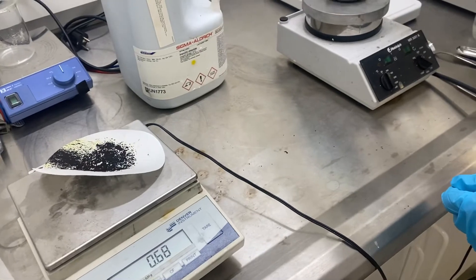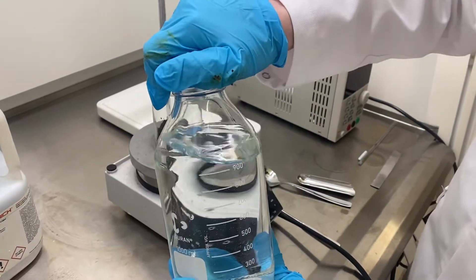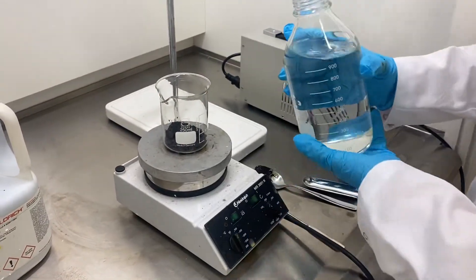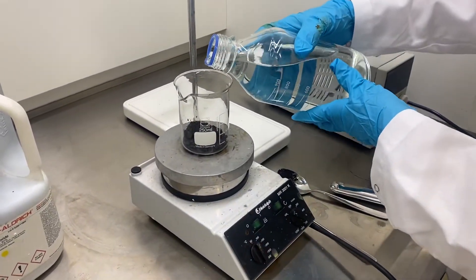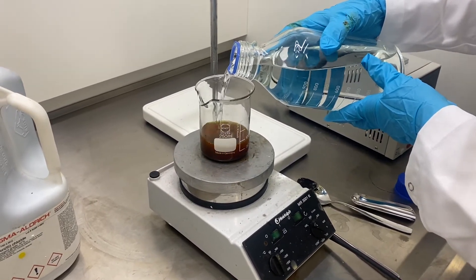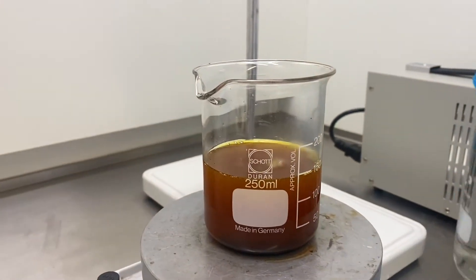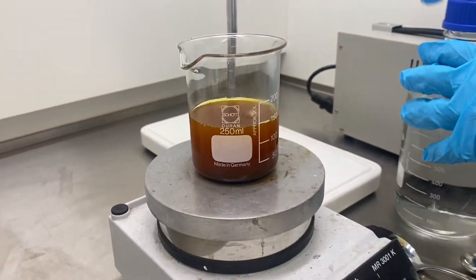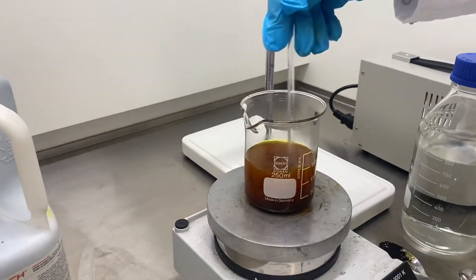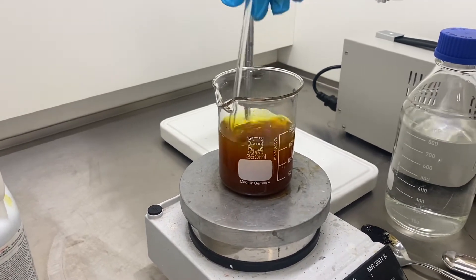Now we're going to add some water to this. Here we have a bottle of regular distilled water — one litre of it. I'm going to pour that in to about half way. You can see it's going brown straight away. I'll take about 150ml — that's enough. I'm going to take a glass rod and stir that around; we need to dissolve all of it. You can see it's brown in colour.